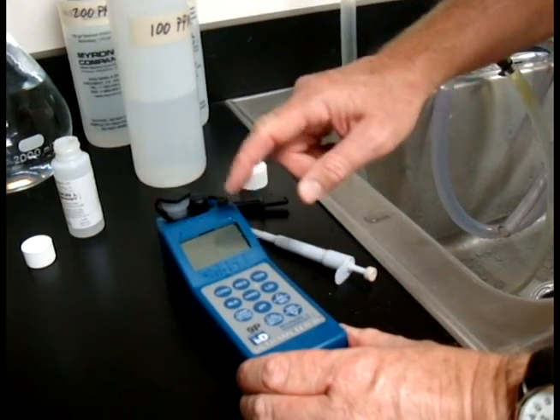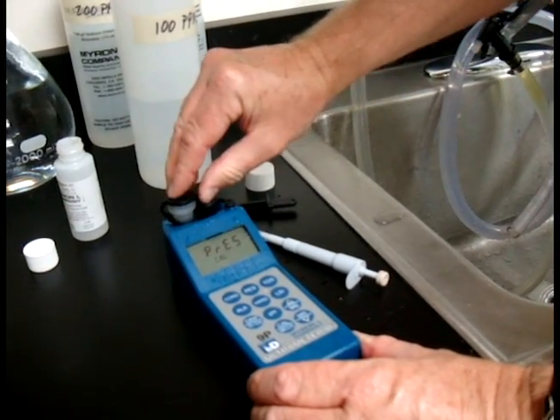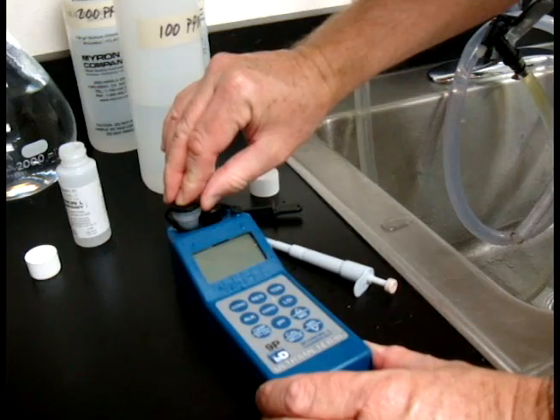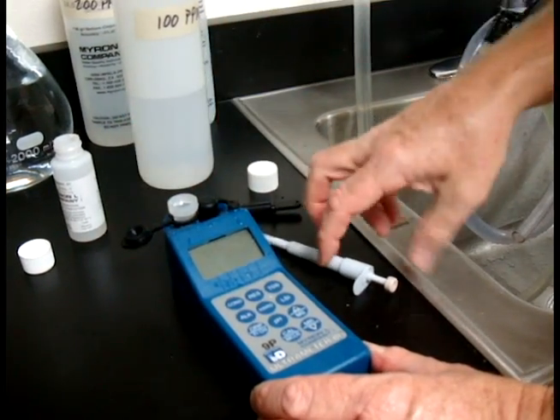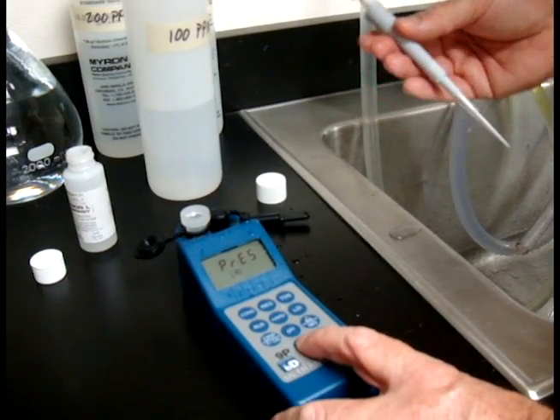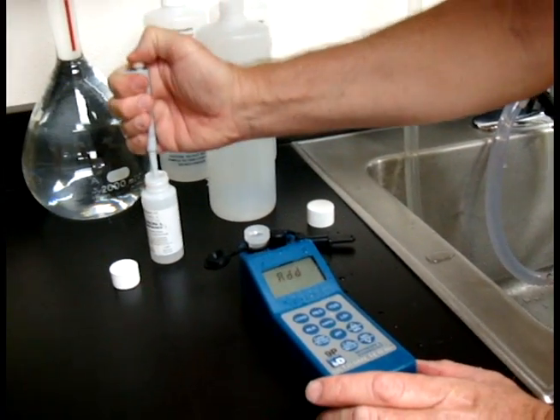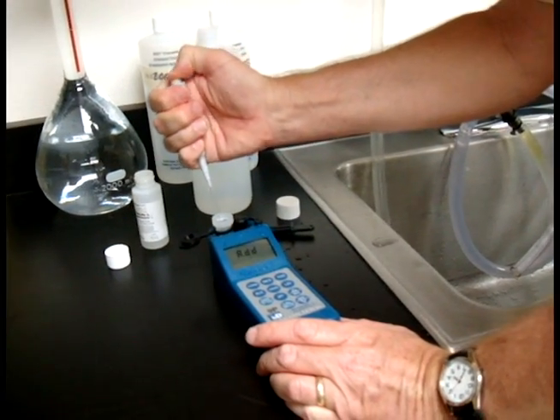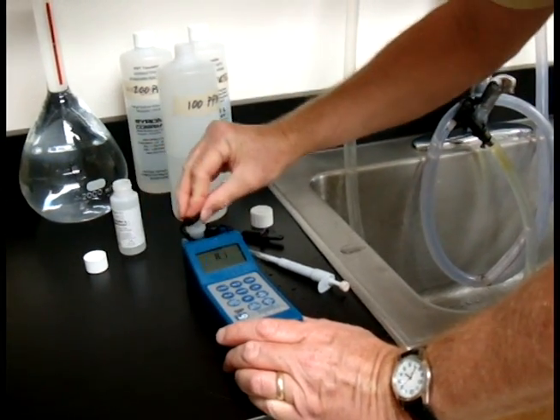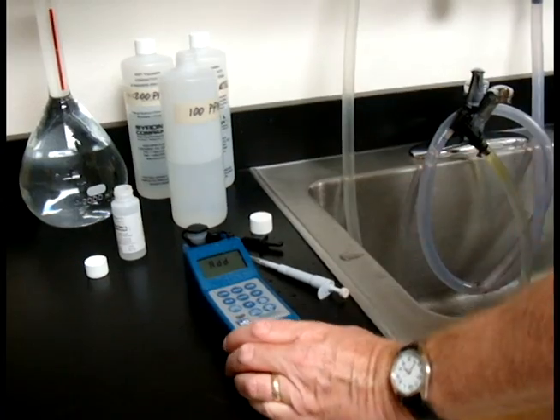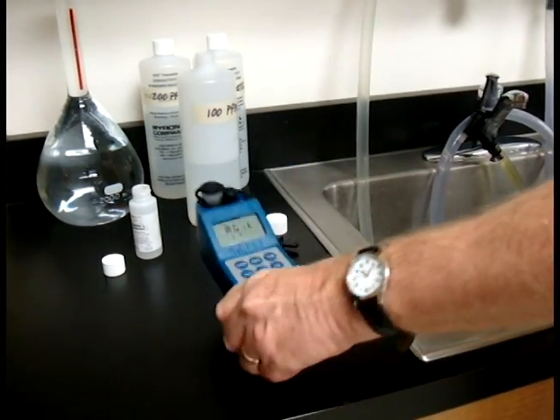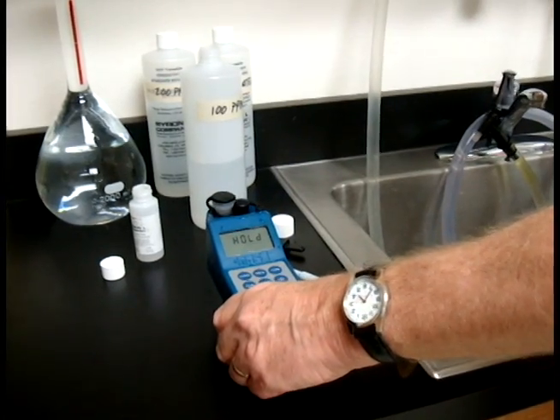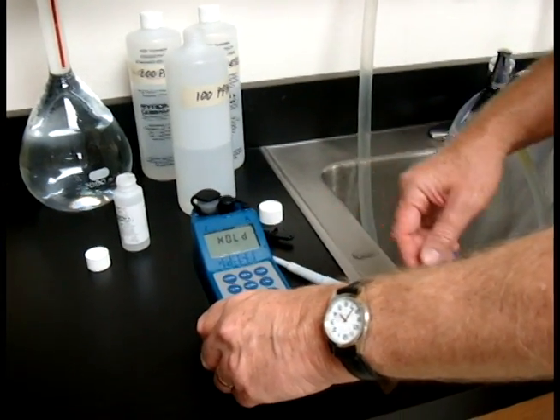And again, before you hit CAL, come over here and make sure that, I like to hit this, get any solution that's adhered to the top. Pull this back slowly. And then hit CAL. Put the cap back on and begin to agitate.